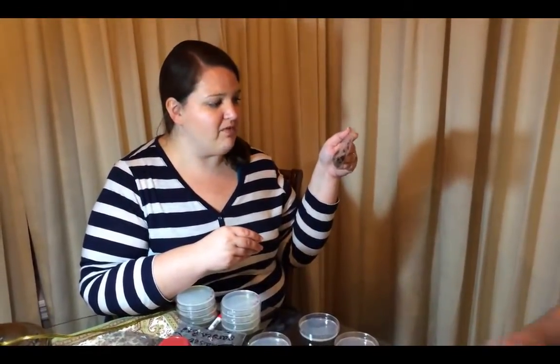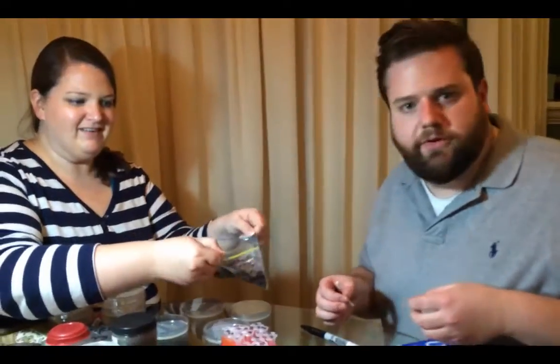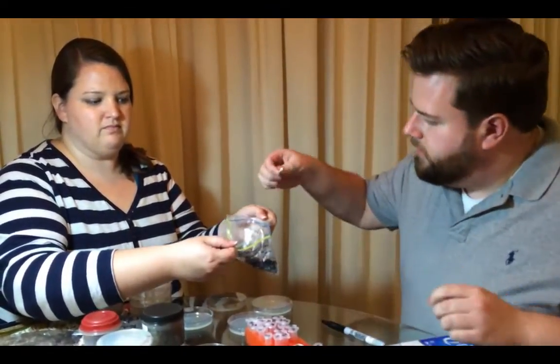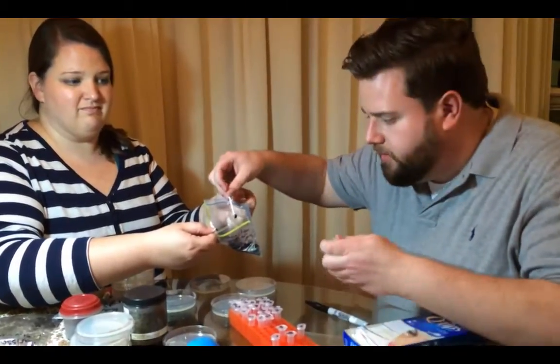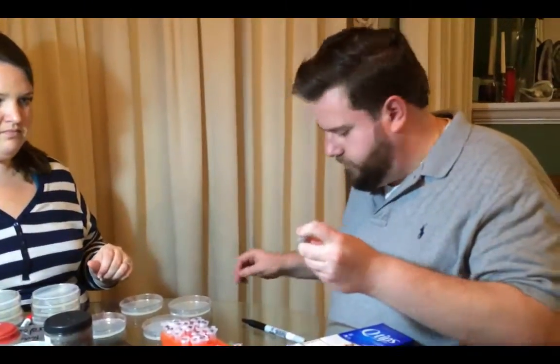I have Sebastian's soil here. He got this soil from his lemon plant pot. We're going to plate it on the four plates of agar already labeled. I'm going to take a swab — which is hopefully pretty sterile, although we don't know that for sure — and I'm going to get some saline solution in this tube. I'm just going to moisten the swab and probe the soil. We don't need a lot of soil because bacteria are microscopically small. I'm going to place the soil in that tube with the saline solution and then throw out the swab.